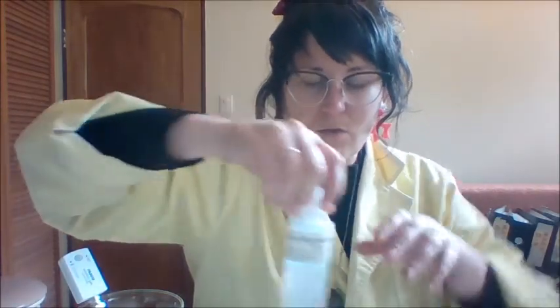All right, so this experiment is basically, I'm just going to measure the pH of a bunch of different amphiprotic substances. So I've got sodium bicarbonate, which is bicarb soda, or sodium hydrogen carbonate, however you want to say it. I've got sodium hydrogen sulfate.